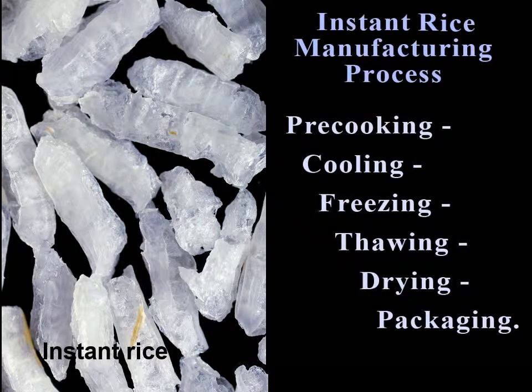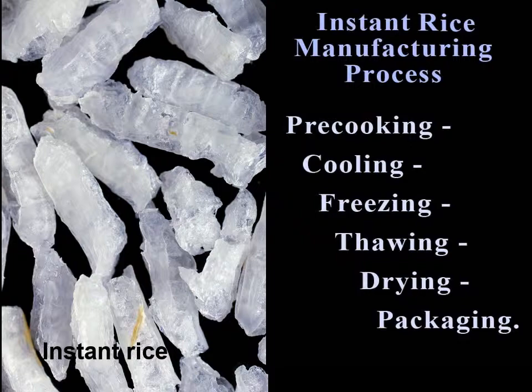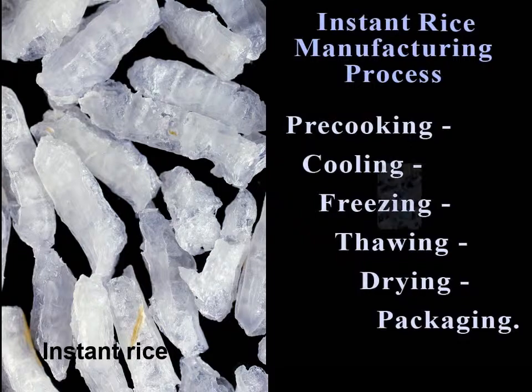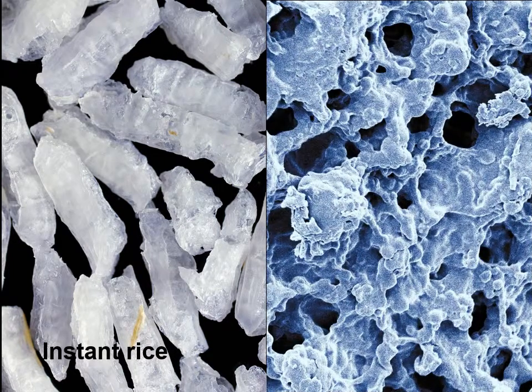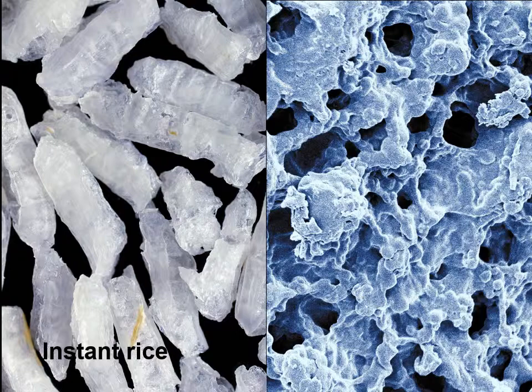What is its principle? Precooked rice is cooled, frozen, thawed, dried, and packaged. Freezing produces minute ice crystals in the rice. On thawing, they melt, and the resulting water evaporates during drying, leaving minute cavities and pores in the rice grains. They thus become porous and rehydrate easily. Although they appear glassy and compact to the naked eye, as shown at left, electron microscopy shows how microporous they are at right.